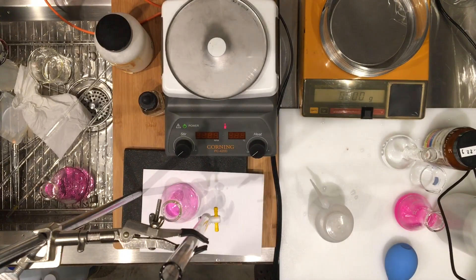Now we have three titrations, so we're going to work with these three volumes. I'm going to record my volume for titration two and then we can calculate the molarity of the original vinegar solution and the percent composition by mass.